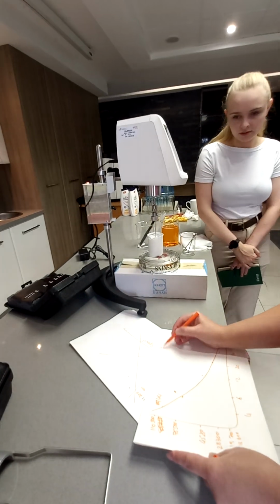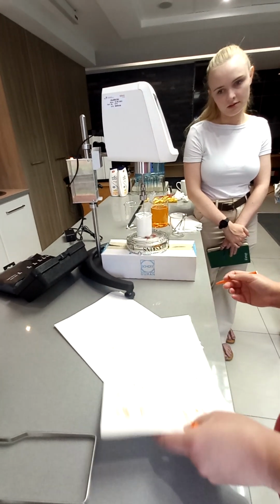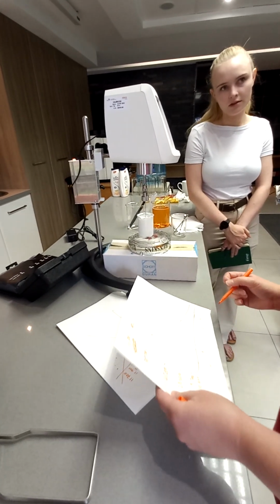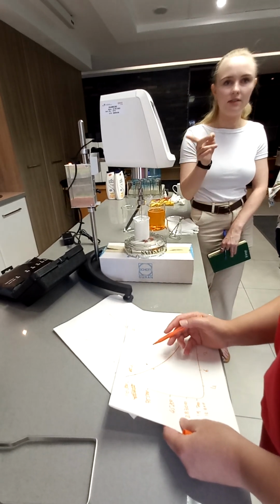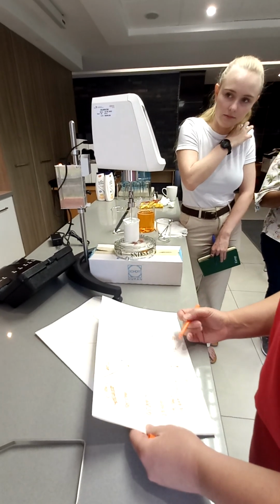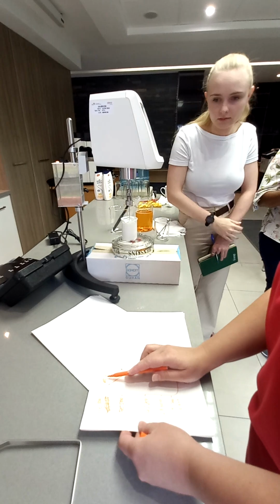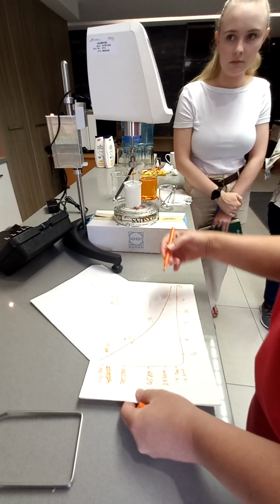This is using spindle 93, which was a good one. And what were all the torques? I can't remember. Does the torque also need to be above 10 to get a more accurate reading? Yeah. I think that was about 44% torque, and then it was like 50, 56.